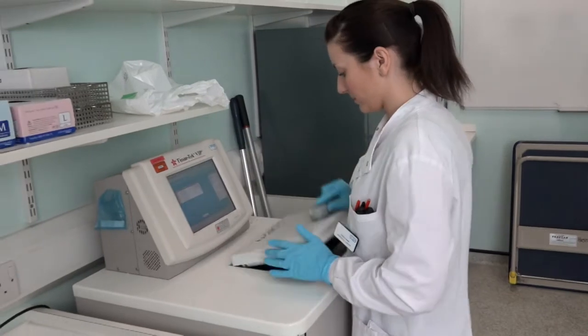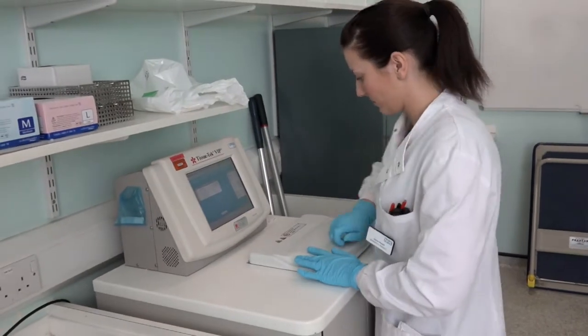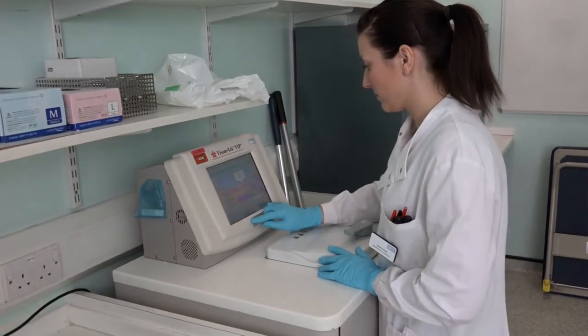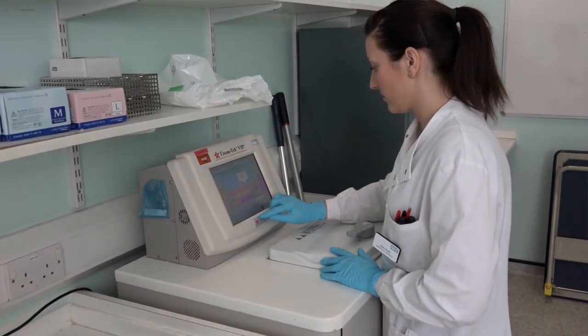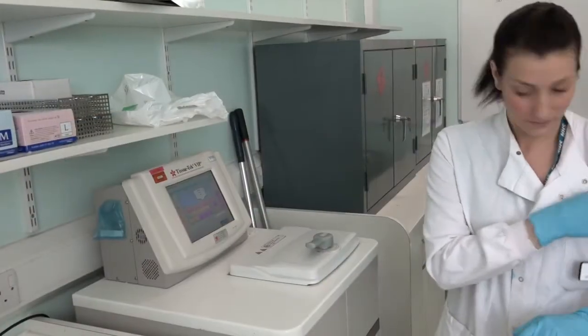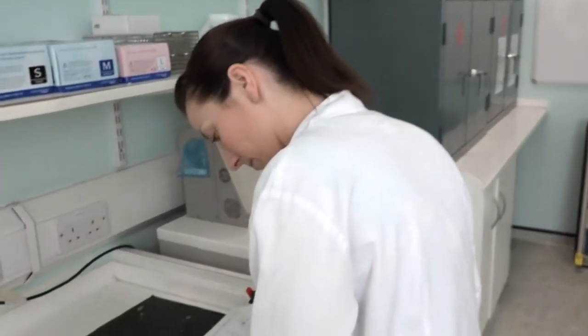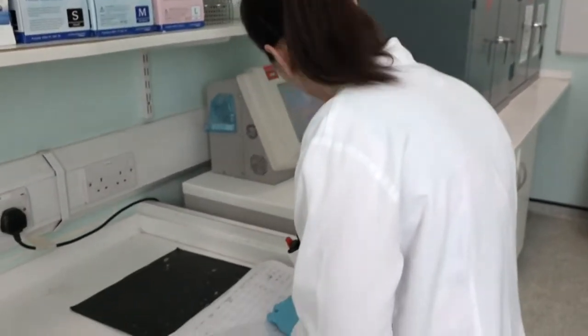Once selected, these get loaded onto a large machine overnight. These machines pump various solutions into the tissue and this prepares the tissue ready for the next step. Once this process is finished the blocks are removed from the machine and they need to be suspended in molten wax.